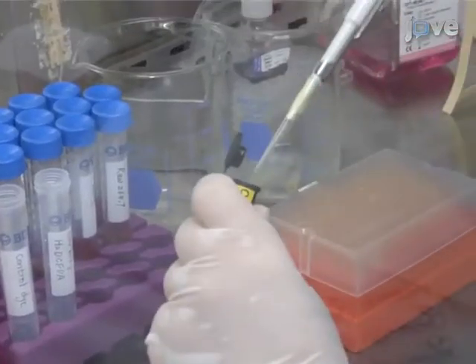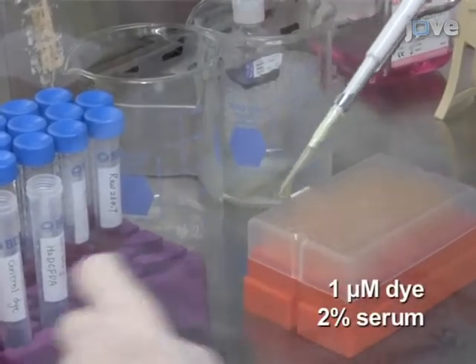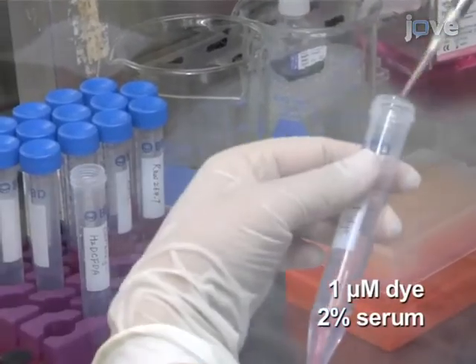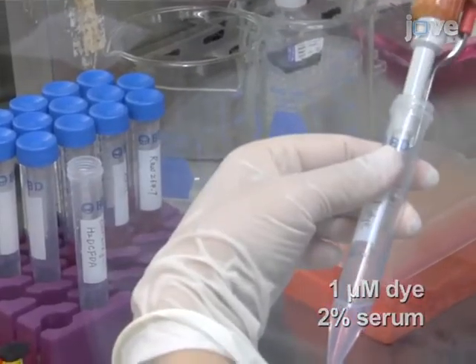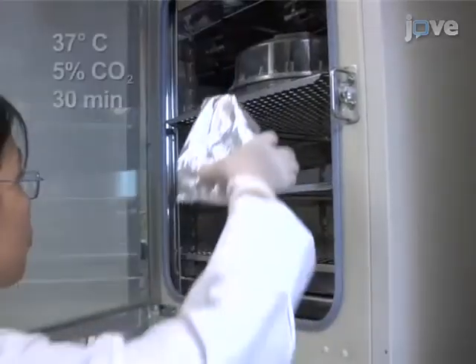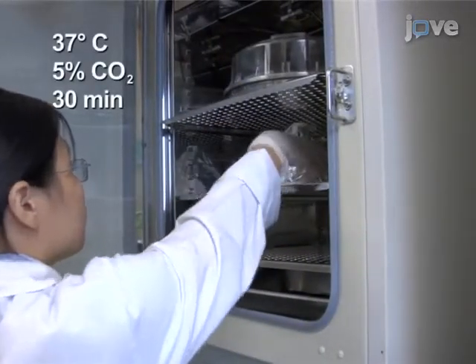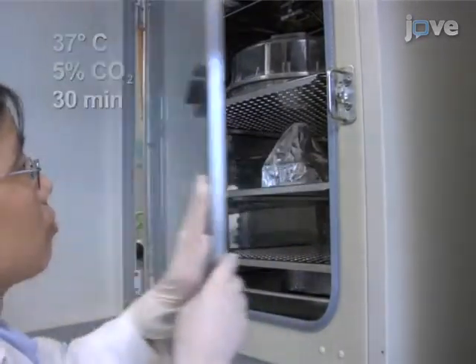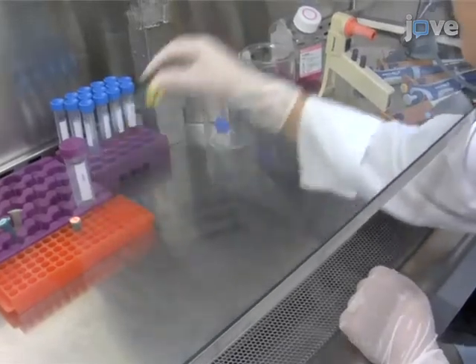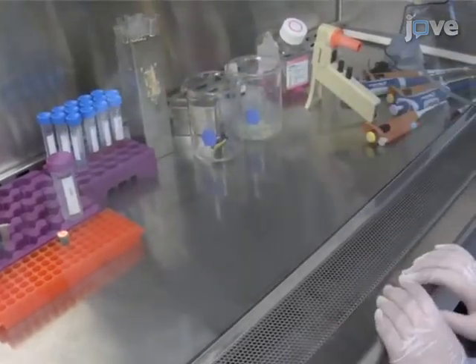Load the cells with the dye at a final concentration of 1 micromolar in regular culture medium with reduced serum. Incubate the cultures for 30 minutes in the dark in a conventional incubator. Discard any unused dye solution.